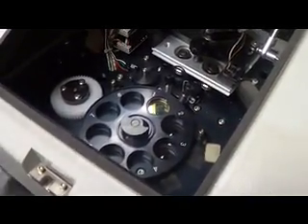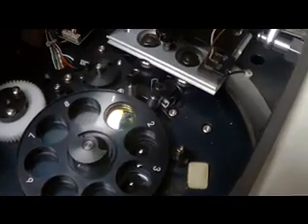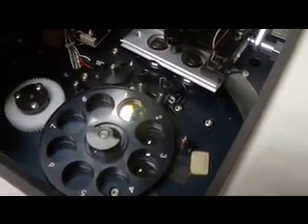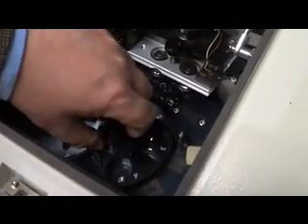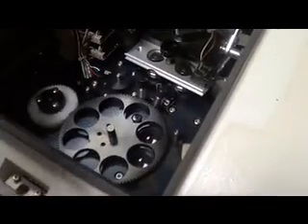You can see position number one is in the 12 o'clock position. Make sure you remember this because it's important that you keep number one in the 12 o'clock position — the filter wheel will not go back inside without position one being in the 12 o'clock position. Grab the wheel and pull straight up and out.